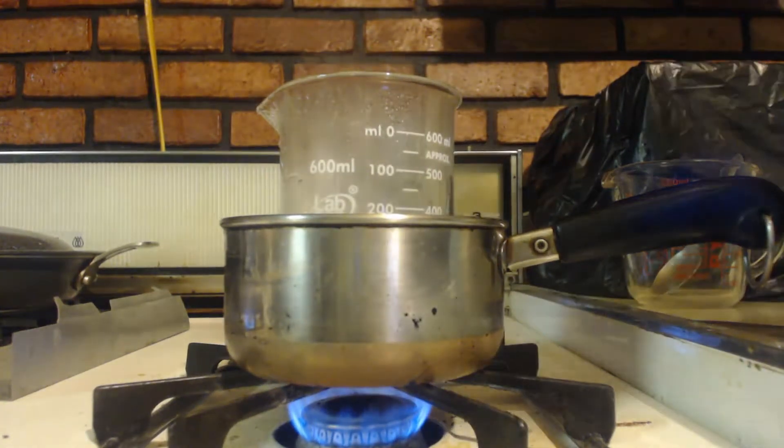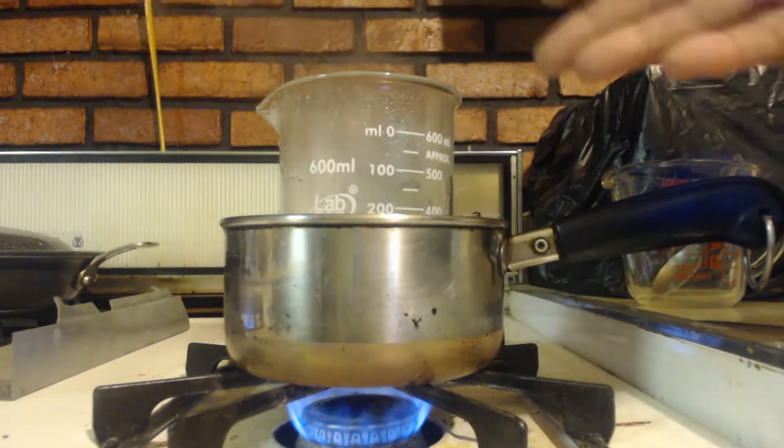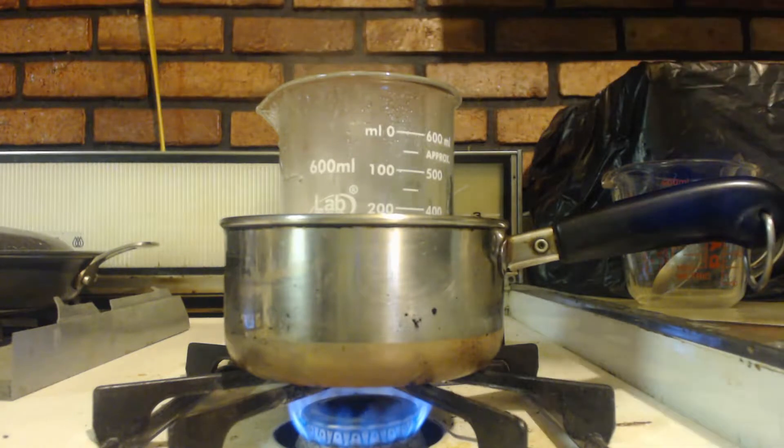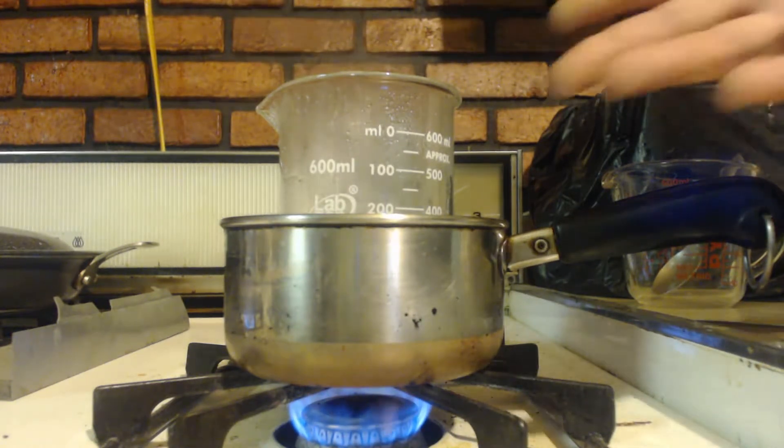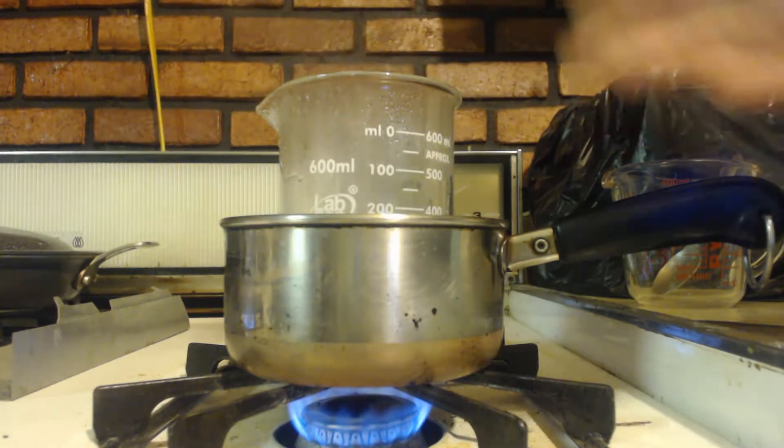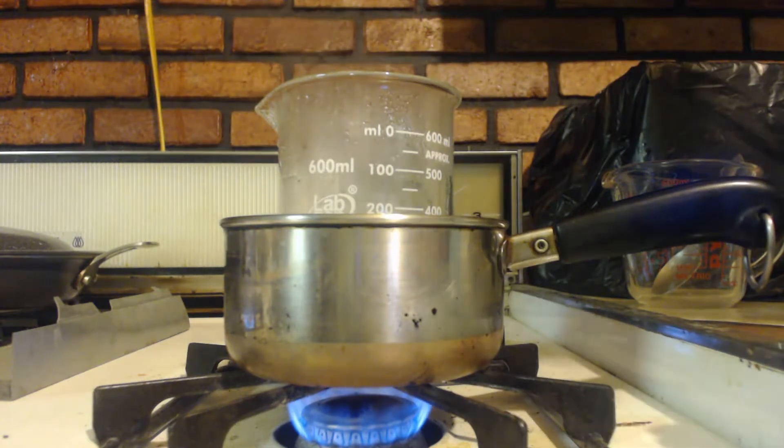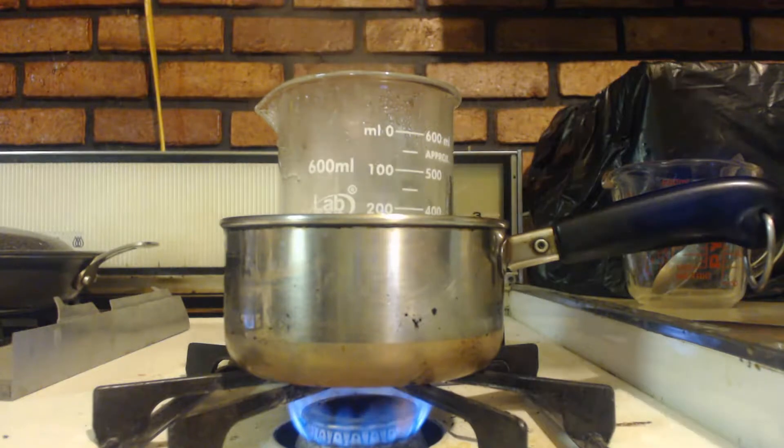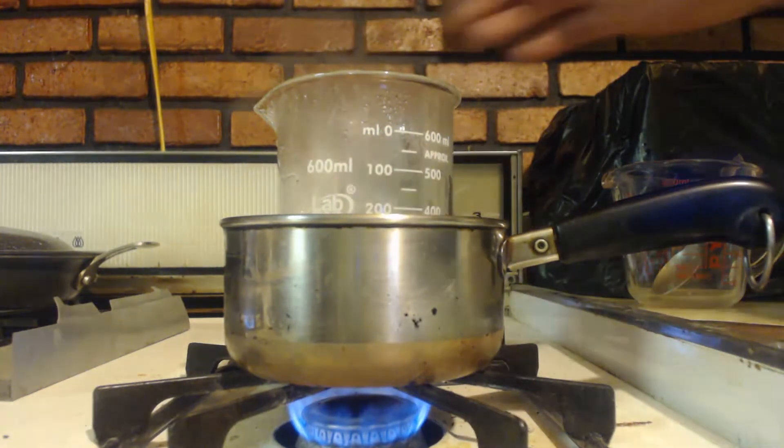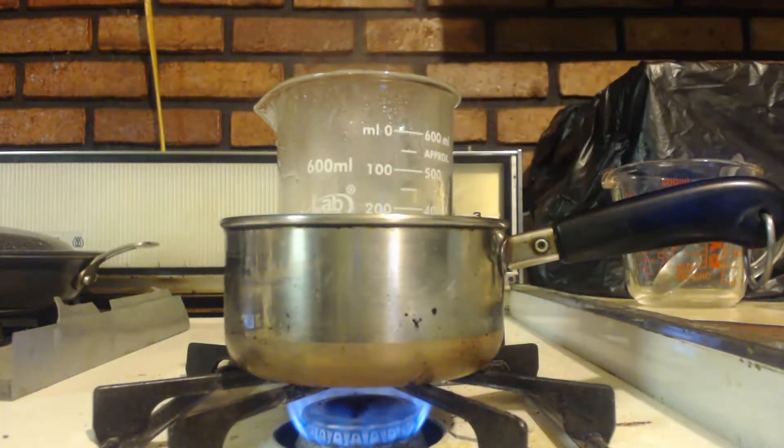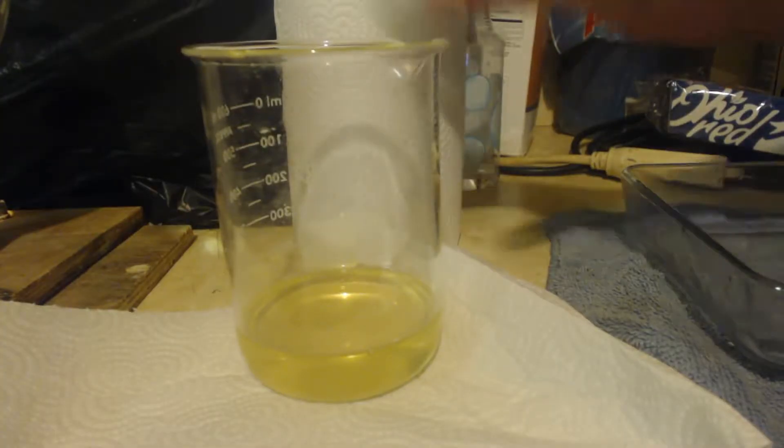You can't really dry this the way you normally would by boiling off all the water to dehydrate it, because if you do that it'll start decomposing the calcium chloride. I'm not trying to make anhydrous calcium chloride, I'm just trying to make calcium chloride hexahydrate.